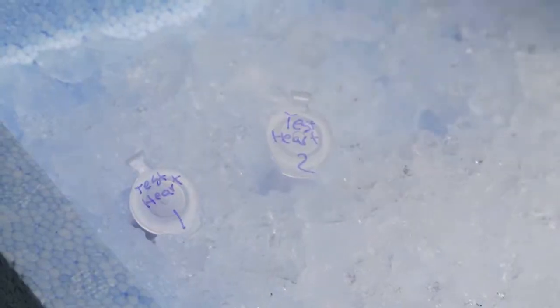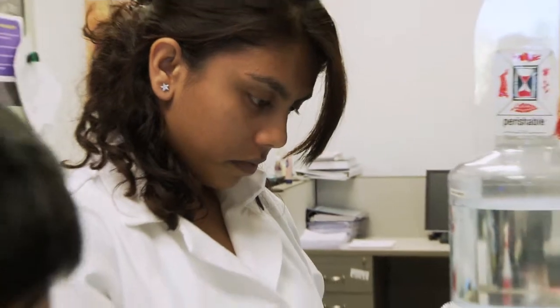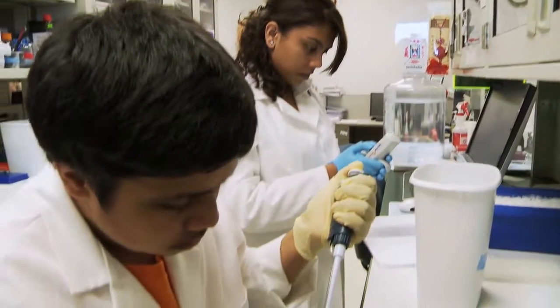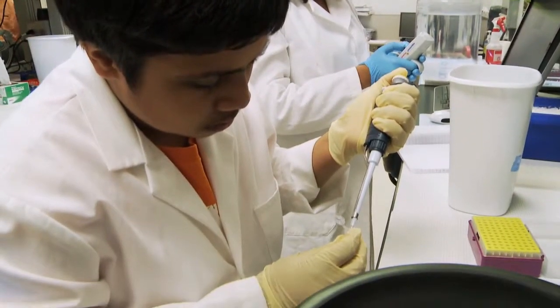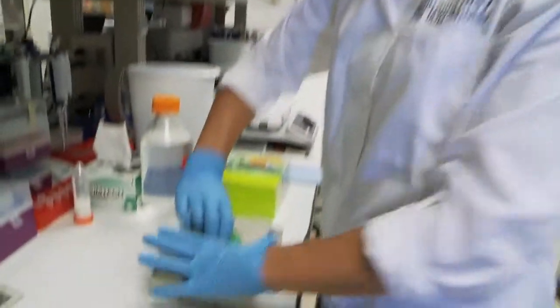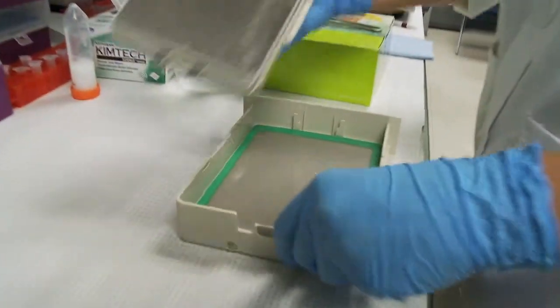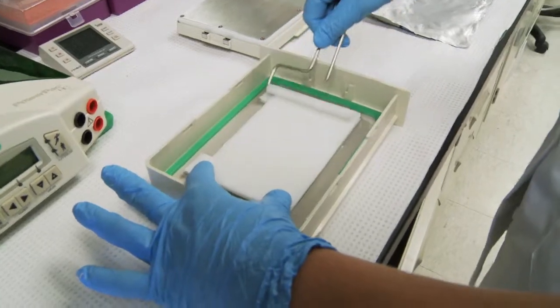With that amount of lysate I have to run protein degradation assays to look at protease activity levels, and then I also have to run a number of Westerns to look at proteins that we're interested in to see if they're changing between the groups.